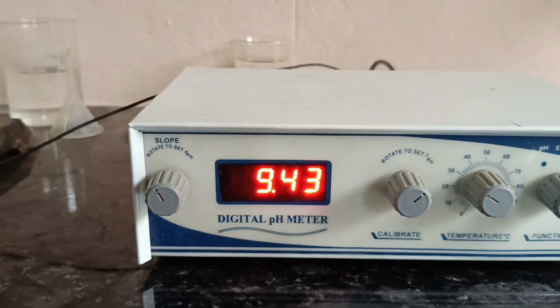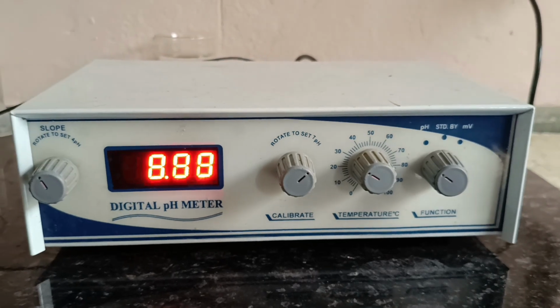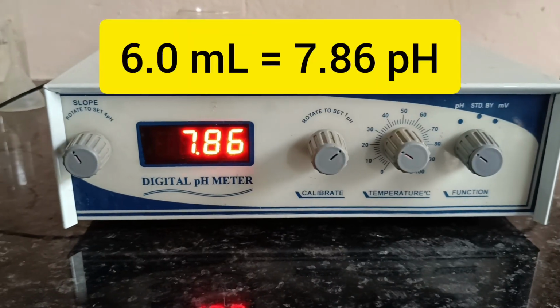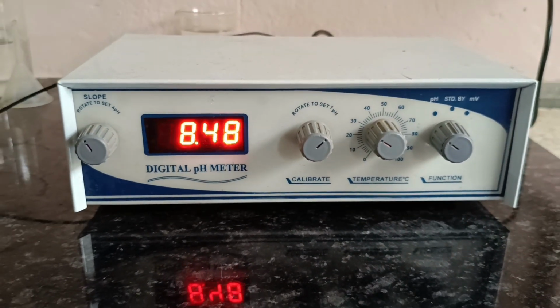We have to wait till the reading becomes constant. See, 6 ml of the solution is added and we are getting 7.86 pH value.